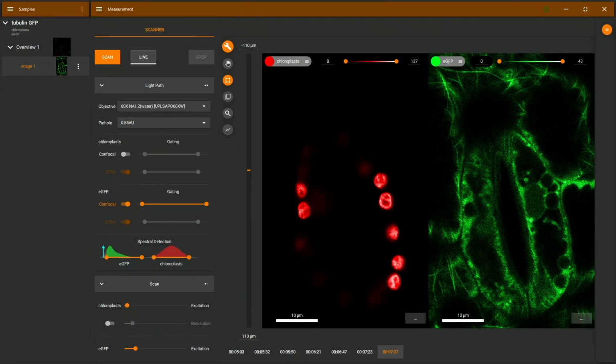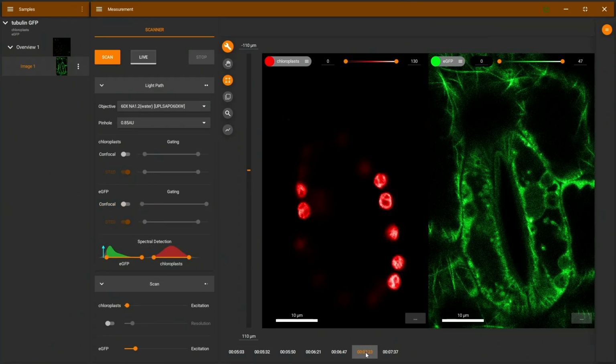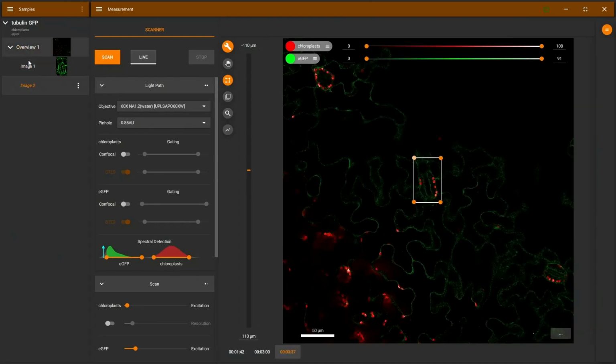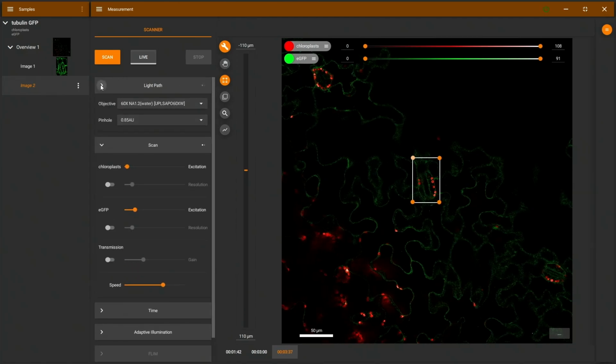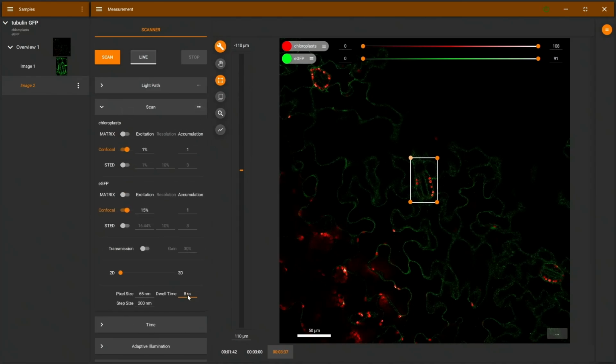Here we are back in the software, and we can see the image which we have just recorded. I would like to pick one of the images where we're using the correct spectral range for GFP. And then I go to the tree view and I drag and drop this into the overview. That duplicates the image, and we can start fresh with a new image, but with the correct settings which we have already established. I'll go to the dwell time here and adjust this up so we can collect a little bit more signal. I will also deactivate the autofluorescence or chloroplast channel. And when I then scan, I will get just one green image.